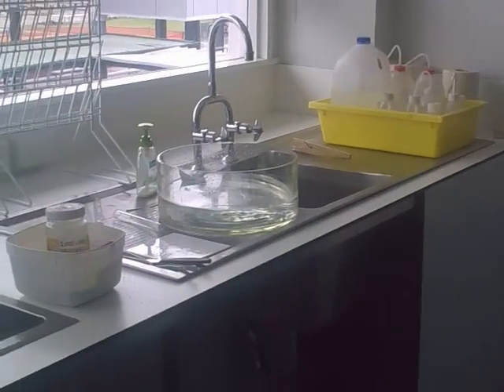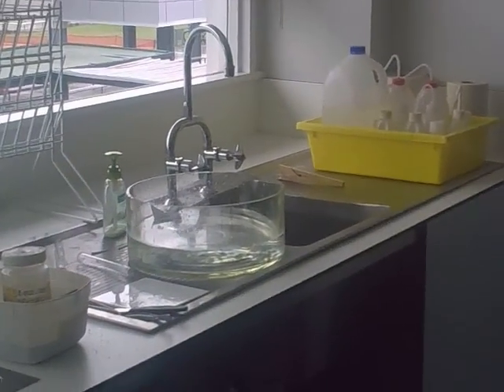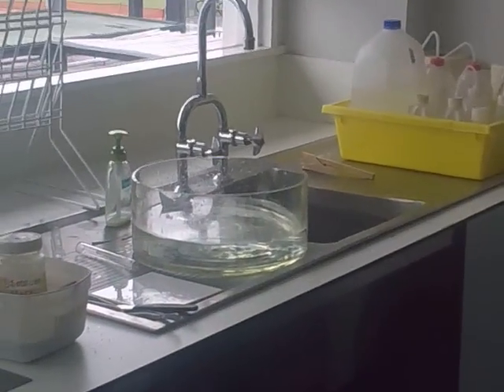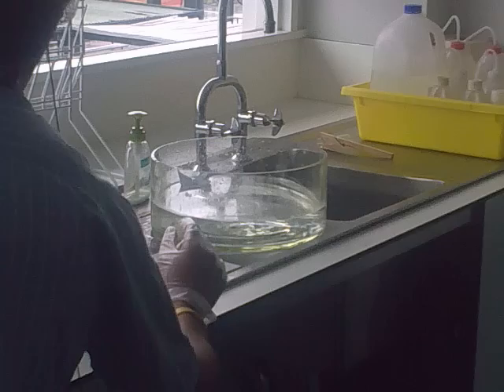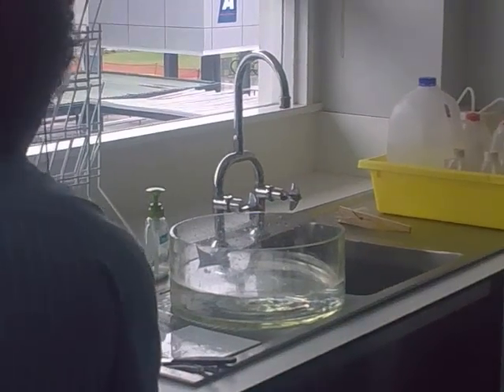Wait, give me the test tube. I'll zoom in. Should I keep a drop on it with the test tube? No, don't go there. Let's leave it. Shirok, just reach over and grab that sodium and take it away. Where is it? Where? No, the bucket. Pick up the bowl. Yes.